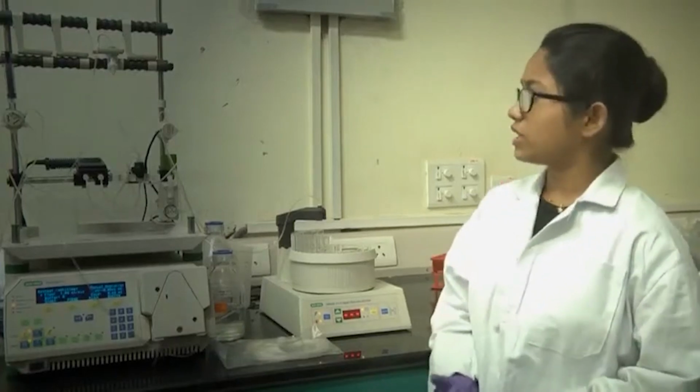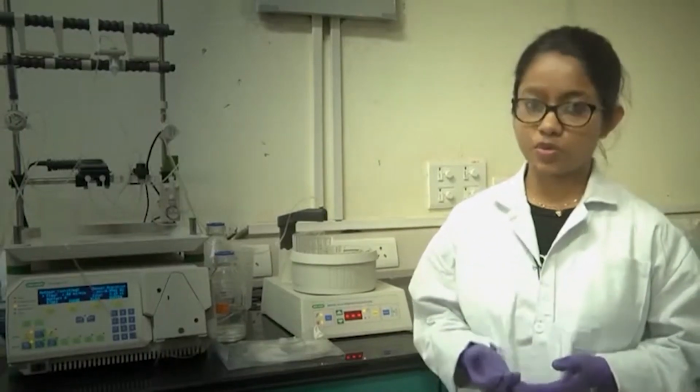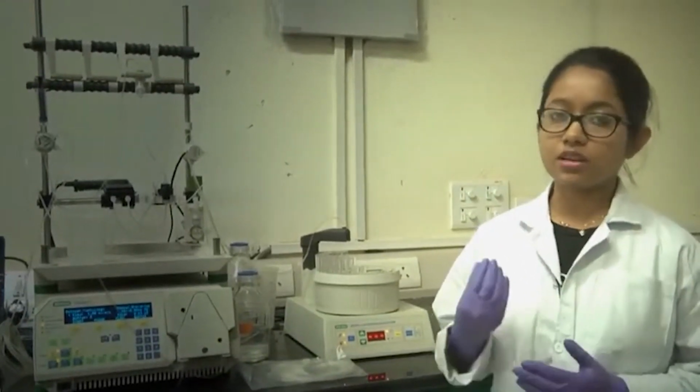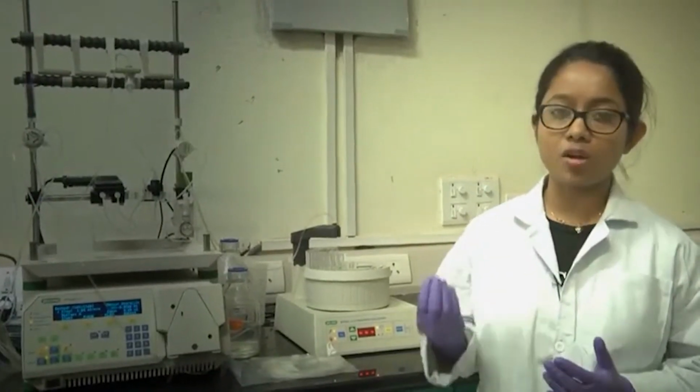I am going to talk about affinity chromatography and how you can separate your protein of interest based on it. Here I am going to use a nickel column, which binds the His tags present in your protein. The basis of this chromatography is that your protein of interest will bind to the column, and then you run a buffer containing another component like imidazole, which will displace your protein and remove it from the column, so you can collect your protein from the eluent.